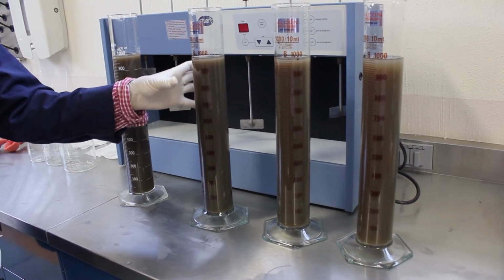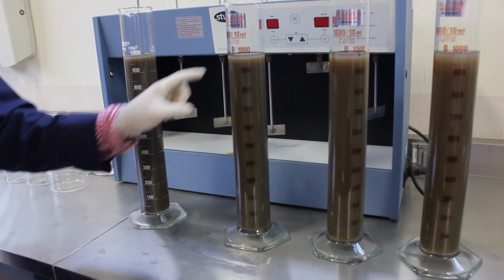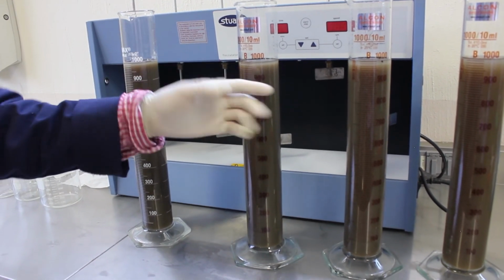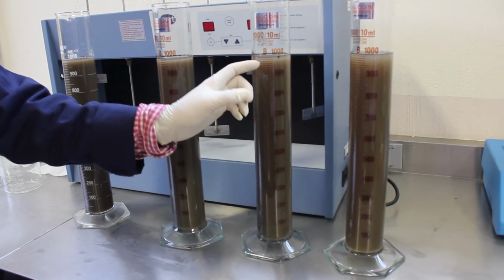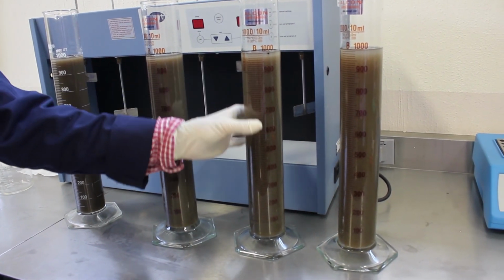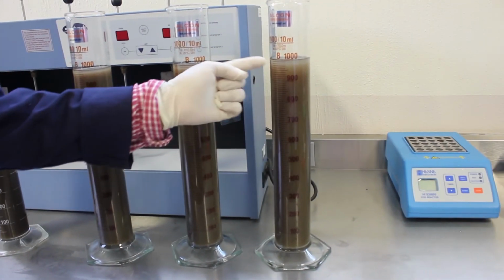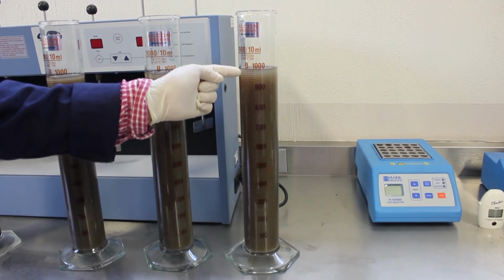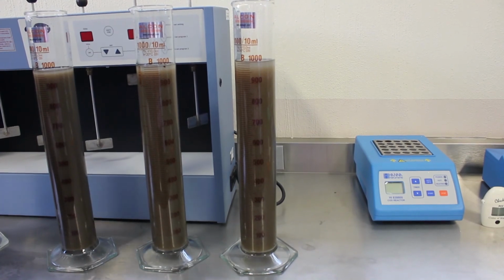In our second column, you start seeing with the mixture that it creates a clarifying water on top. Then in our third one, it's a little bit quicker as it settles down. And in our last one, in just a matter of seconds, you can see that all the suspended solids are actually settling in the bottom.